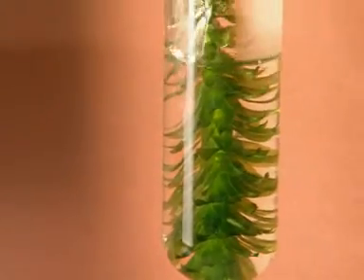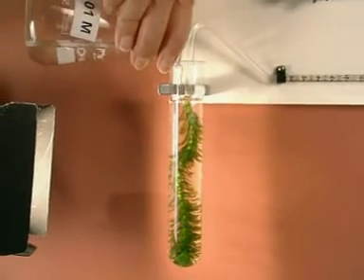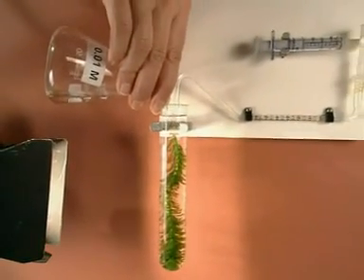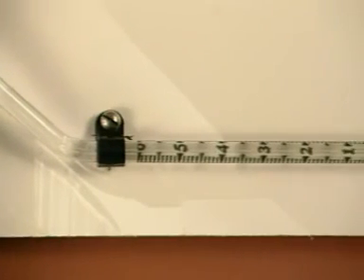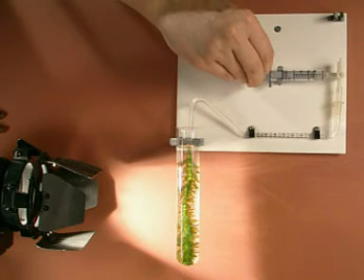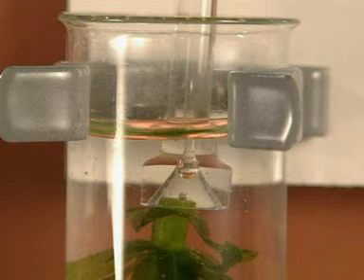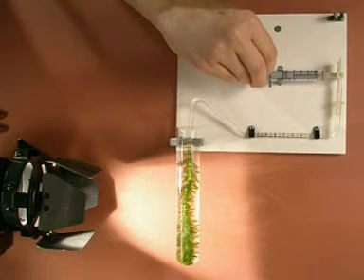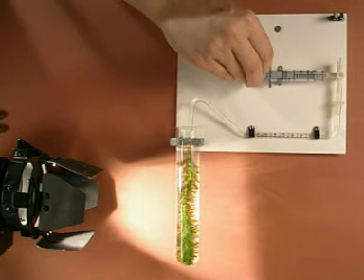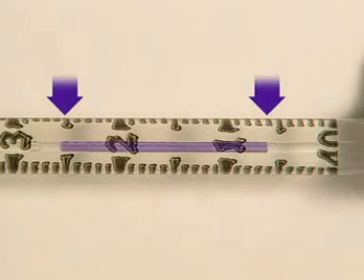To begin with, the plant is immersed in a 0.01 molar solution. A small funnel attached to a capillary tube is placed over the top of the plant to collect the oxygen produced. After a period of equilibration, the solution is drawn through the capillary tube to remove any air. The oxygen produced is then collected for three minutes. After this time, the gas bubble is pulled into the capillary tube so that its length can be measured. It's 19 millimetres long.